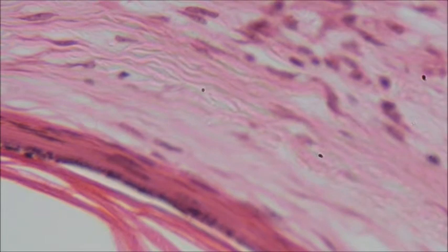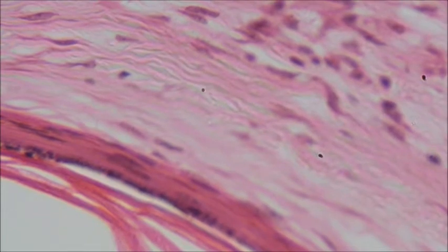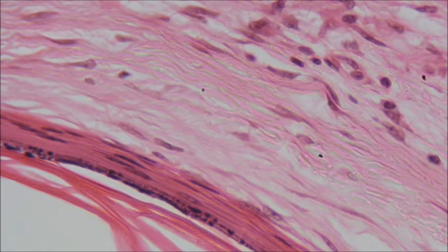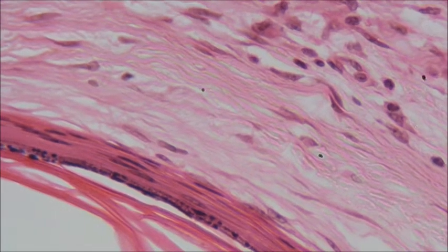So a lot of these cells, like skin cells, they're quite long and skinny. So, sorry. Let me get it back. There we go. Sorry, gentle viewers. There we go. So you can clearly see those nucleuses, and you can see the kind of flatness of the cell.